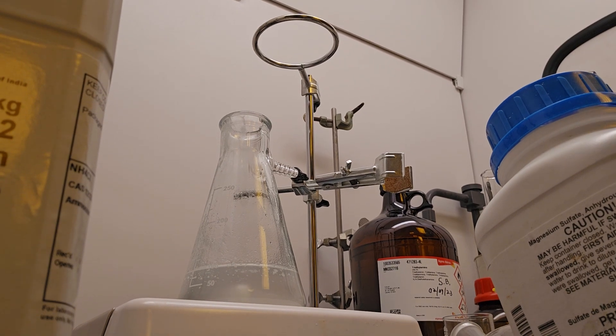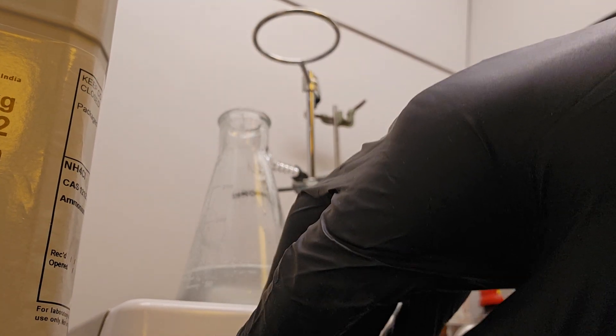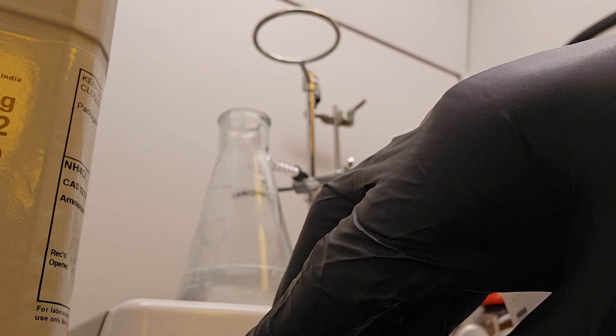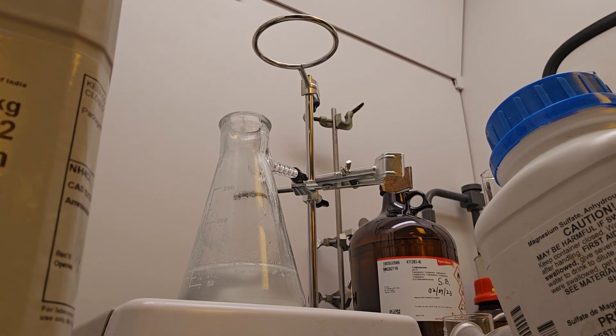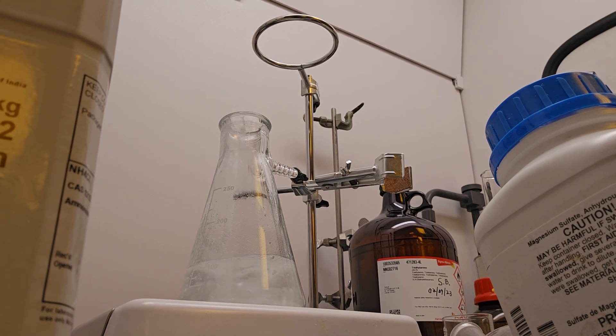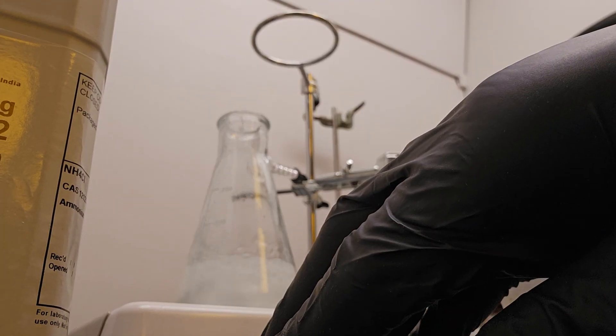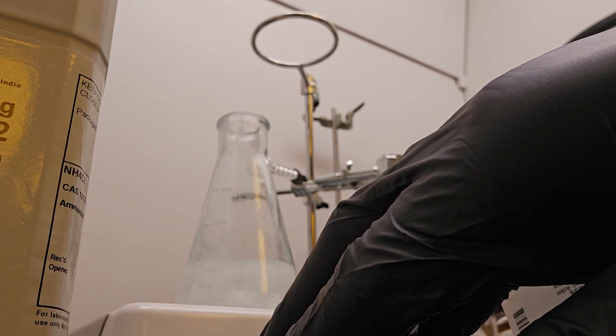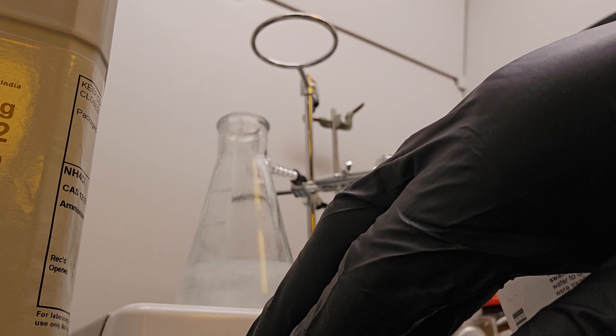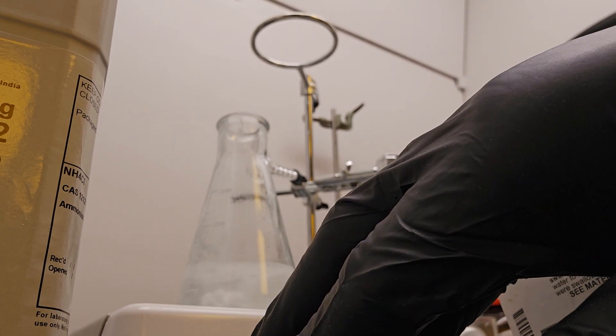So it looks like we may have sucked out a good amount of water out of our organic solution. Our organic solution is dichloromethane. I'm doing this once again to break up that clump and see if I can make sure I get some really good clumping action.